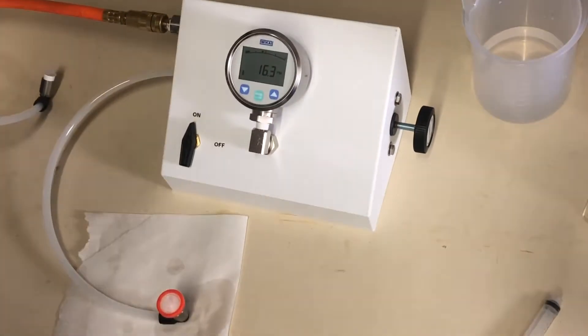We'll allow that to stabilize for a minute. And as you can see, the hydrophobic membrane is now preventing water from passing through the filter.